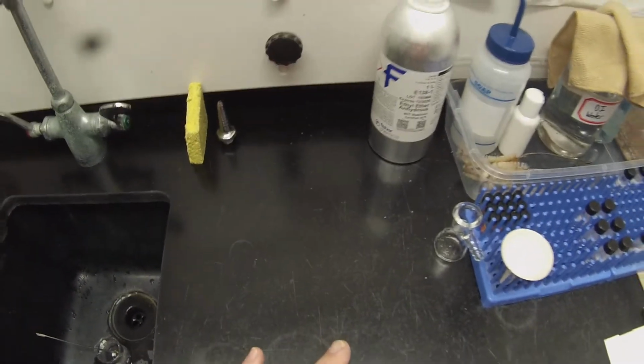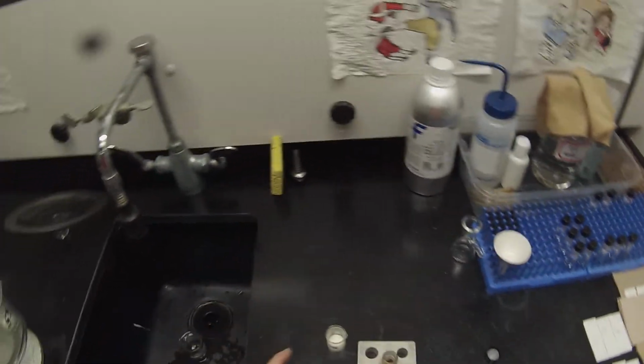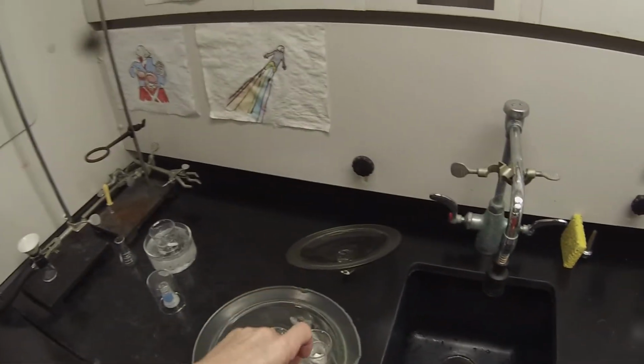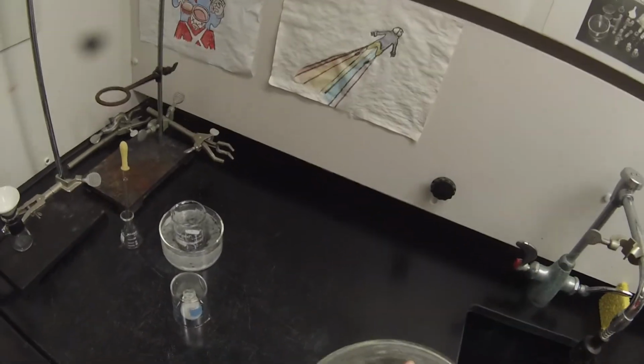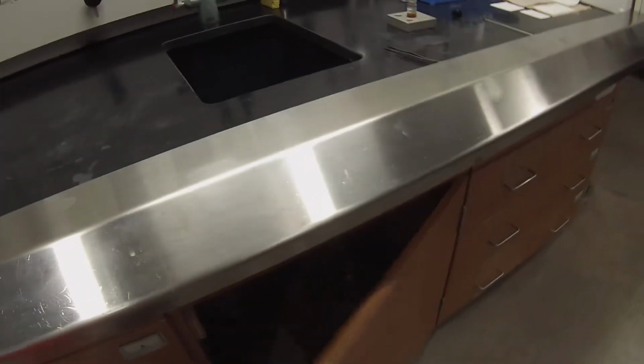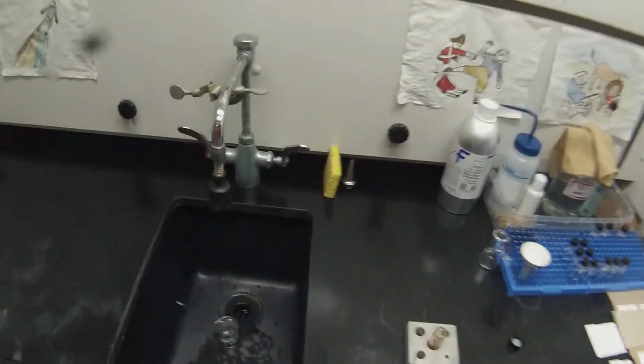It'll give it a good surface to crystallize on. I'm just going to drop that crystal in there. So with that seed crystal in there and letting some of the ether evaporate, we hope that maybe it will start to come out.